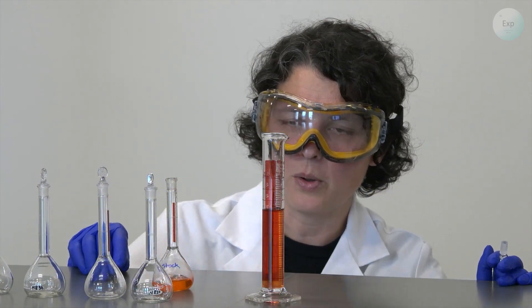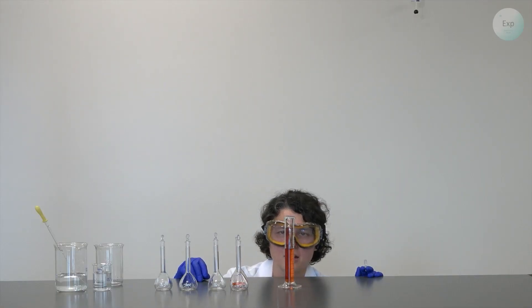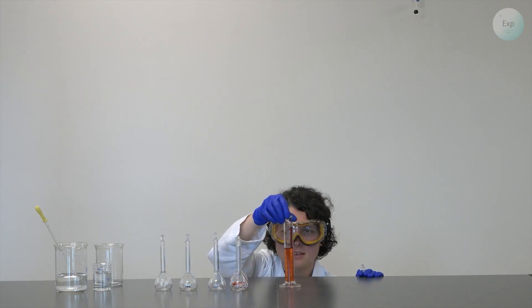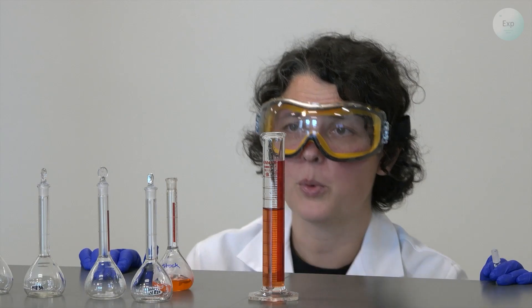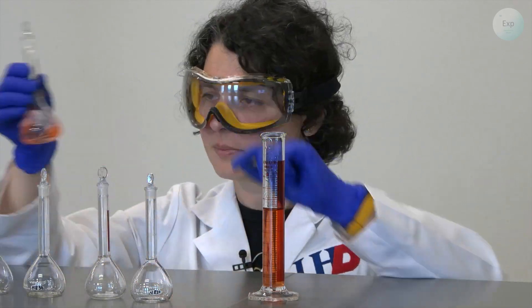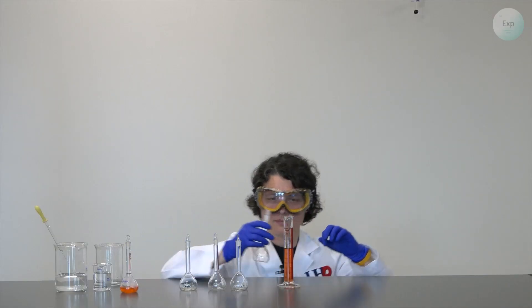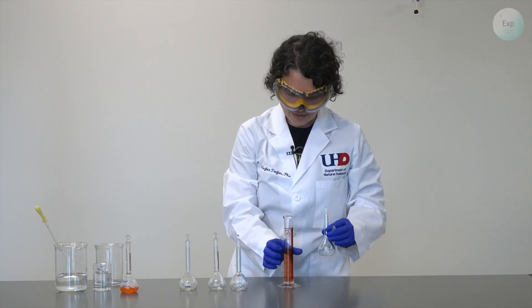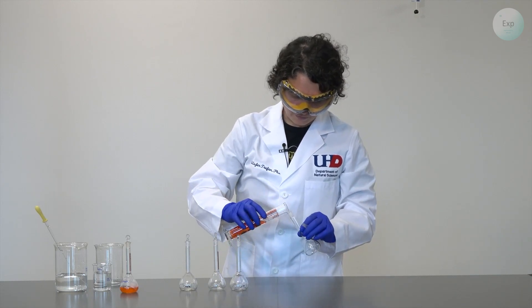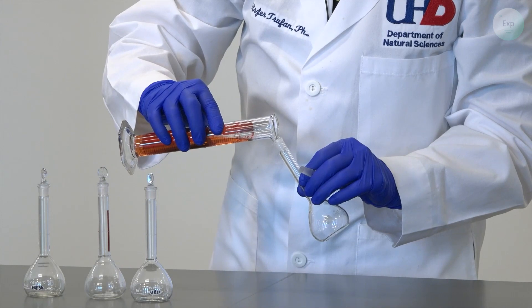We'll try to remove all the air bubbles, record our volume as accurately as we can. It is 35.1 milliliters. And now we transfer this all into our first empty 50 milliliter volumetric flask.